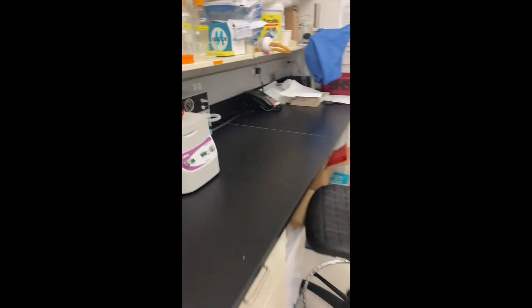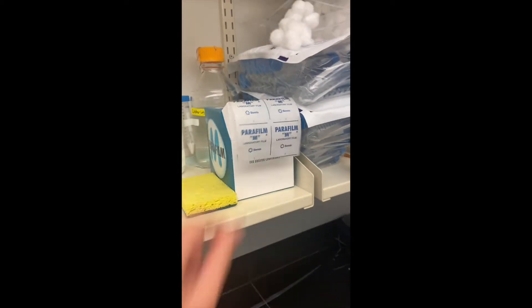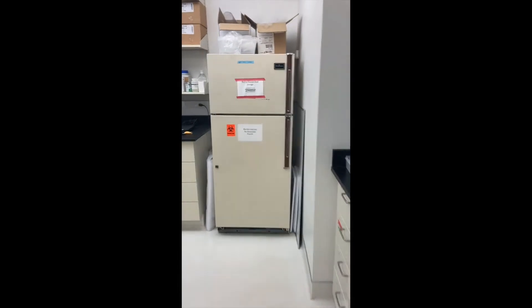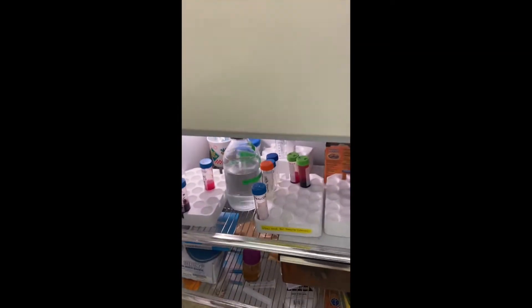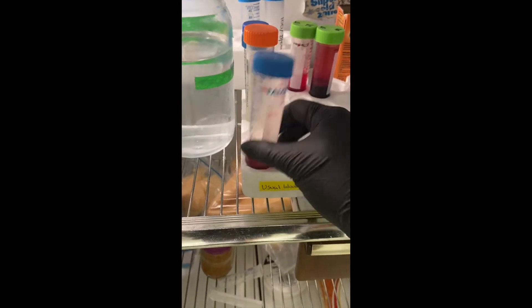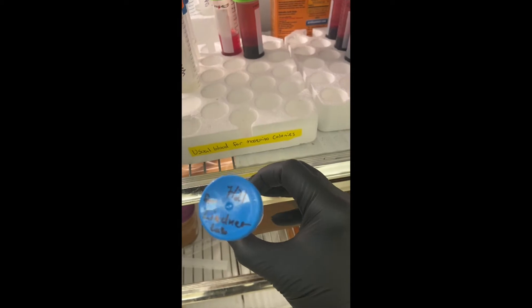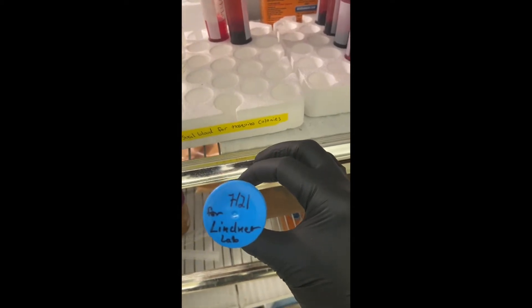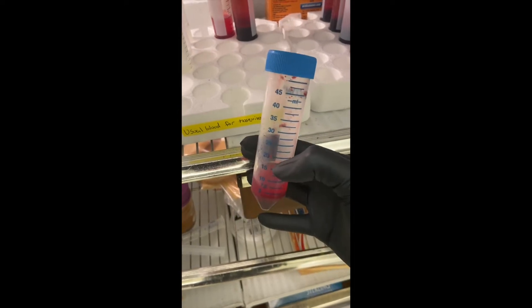In here you'll need blood, a lab coat, two squares of parafilm, and the blood. We keep the blood in this fridge, always on the middle rack, and it's always labeled. The Linus Lab labels it for the Lindner Lab with the date. Don't ever use blood that's more than a month old. It's the 18th right now so this one is still good — that's our current aliquot.